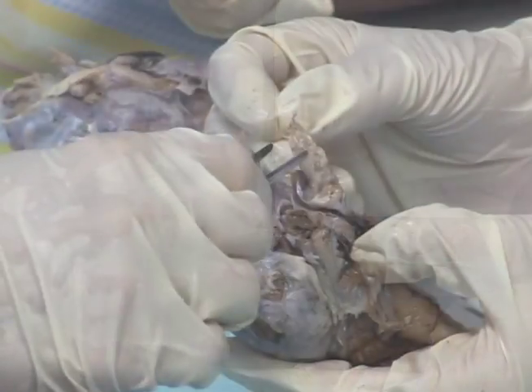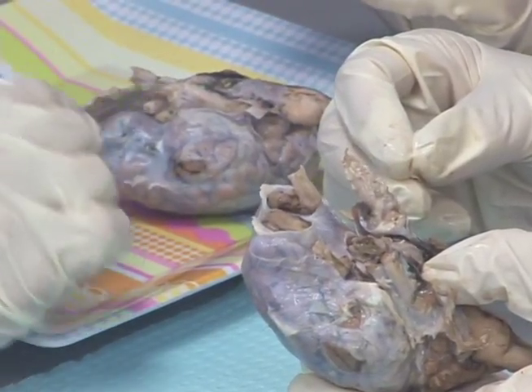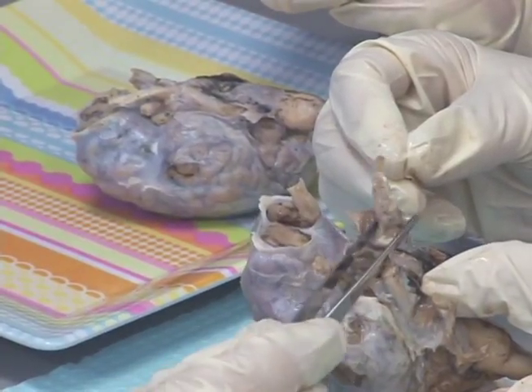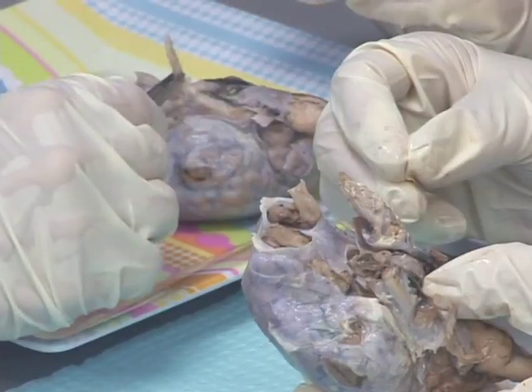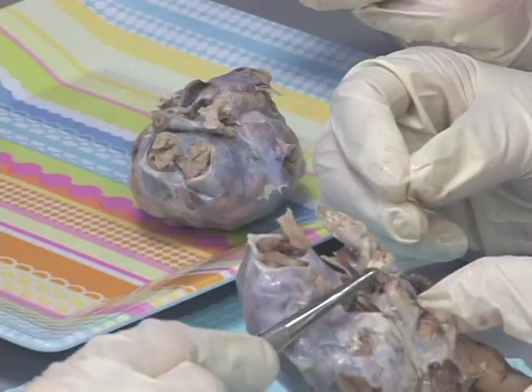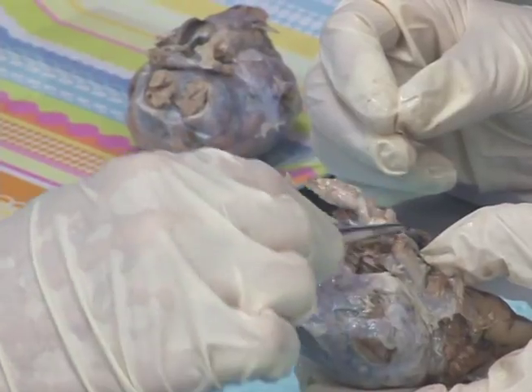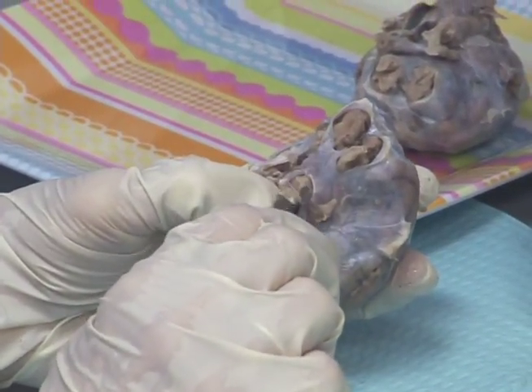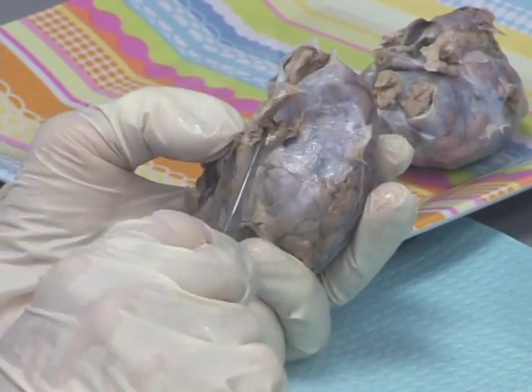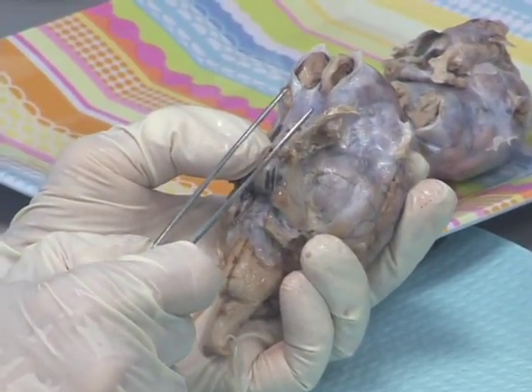Those are called cranial nerves. One brain had pieces of muscle coming off the optic nerve — those were muscles going to the eye. You've got big nerves here. There's a nerve on this one, and this one has actually got some muscle around it. There's the optic chiasm and the nerve is missing on both sides. This is muscle around the trigeminal nerve, which is the fifth cranial nerve. That fifth cranial nerve innervates the muscles of the head and neck.